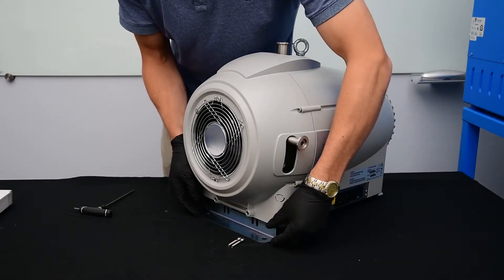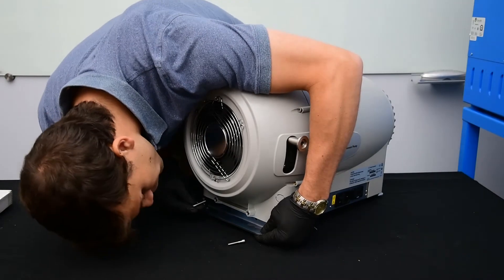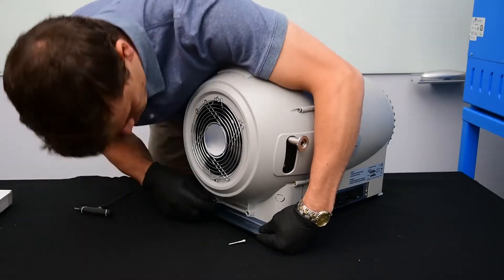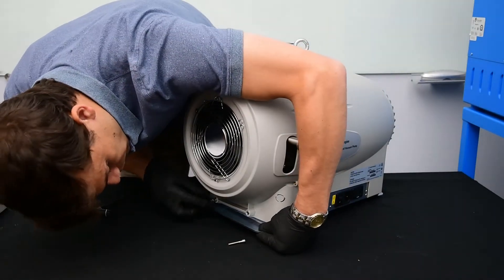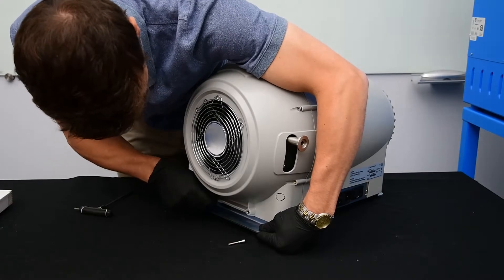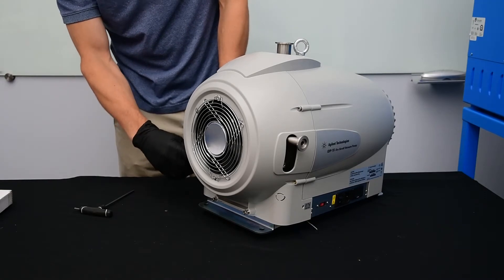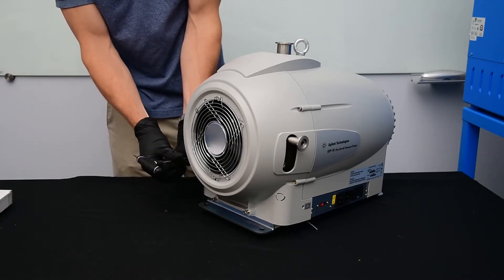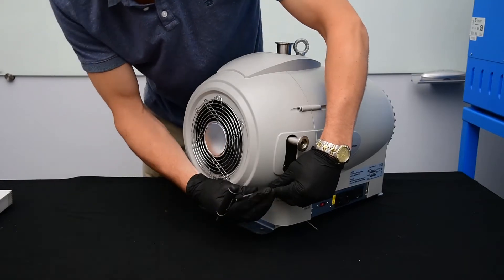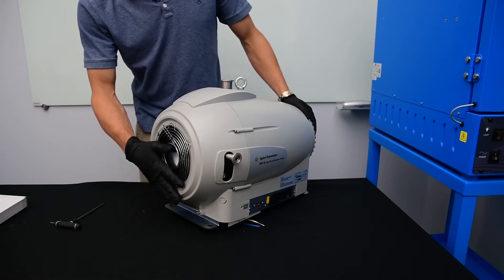Remember to attach the foot and the bottom before finally screwing in the cowling. Now to better access these final two bolts, I'm going to flip the pump up on its end. This will give me better access to tighten them.